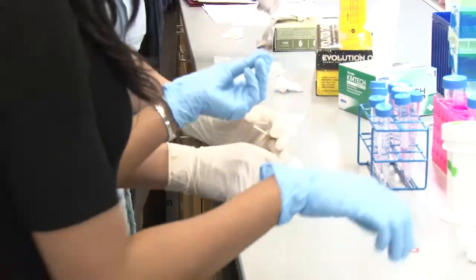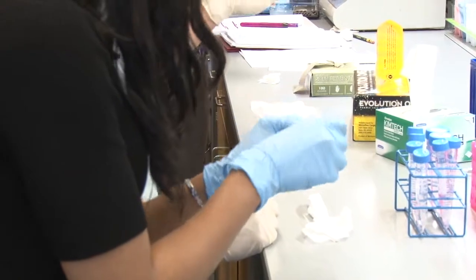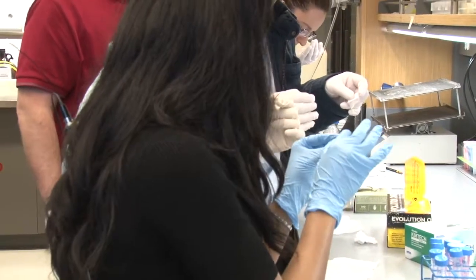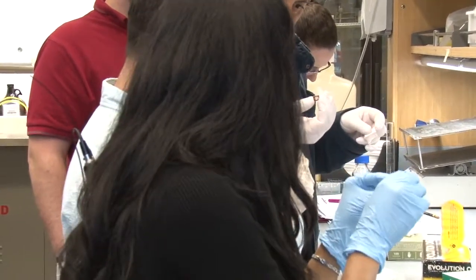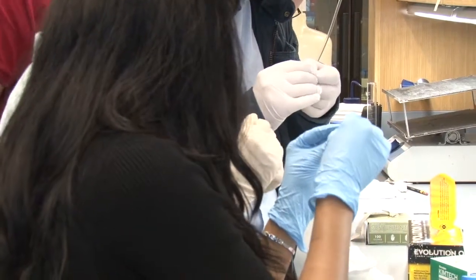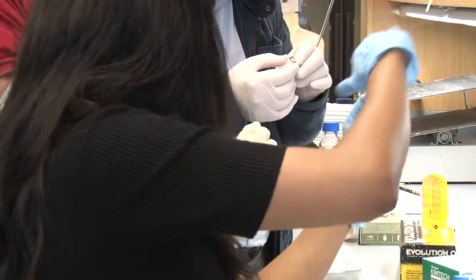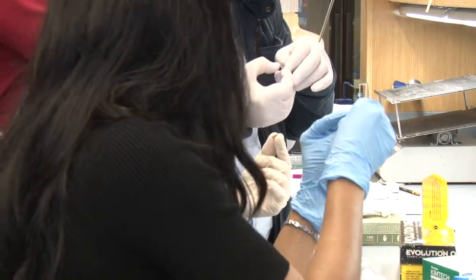If you look at it, it has two ports, and you're going to use those to add and remove liquid. Right now both sides are sealed. There is one which has an adhesive peel and one which looks thicker — make sure you don't take out the one which looks thicker. That's actually the top surface which has the port. Take out the one which has the flimsy adhesive.